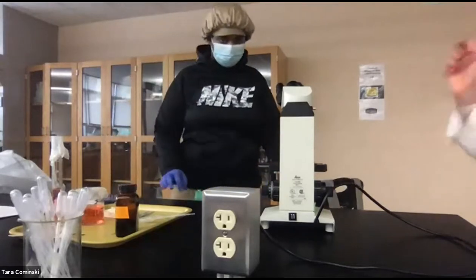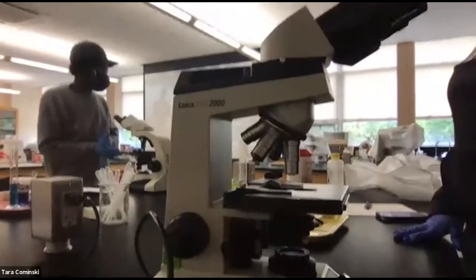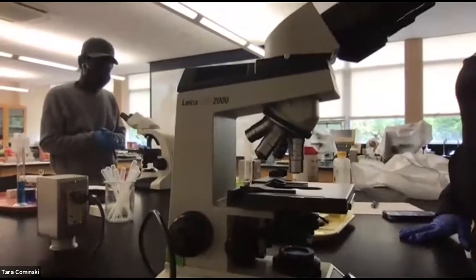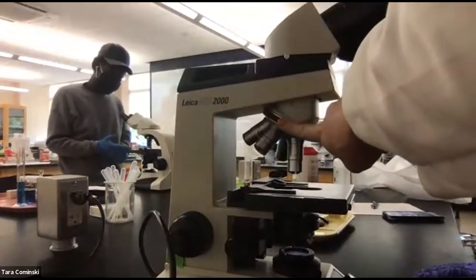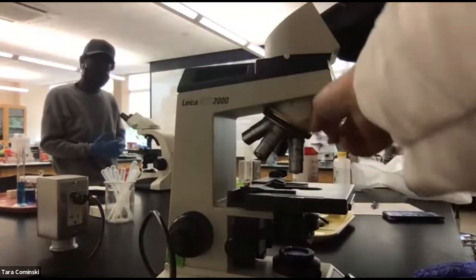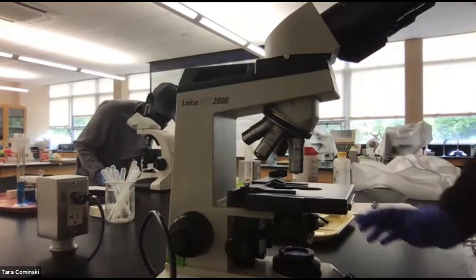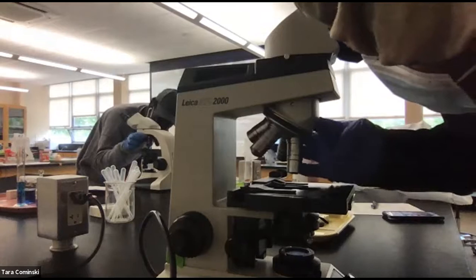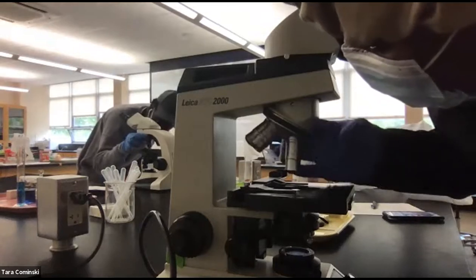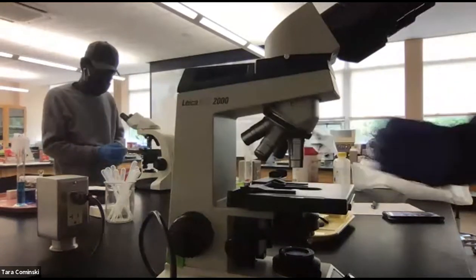Okay, so what you want to do first, guys, with the microscope, is I'm going to just put it here so you can see your microscope well. Perfect. And Sting's in there too. All right, cool. So you want to turn this here. This is how you switch the objective lens so that the scanning one is in the middle, clicks in the middle. So turn it so you get the scanning one in there. That's the lowest power one you have on there. Usually it's red. All right, there you go. Click it in. Got it? Clicked in there?